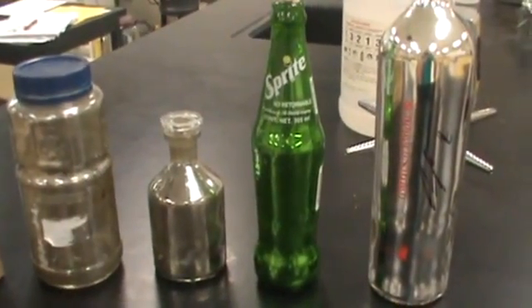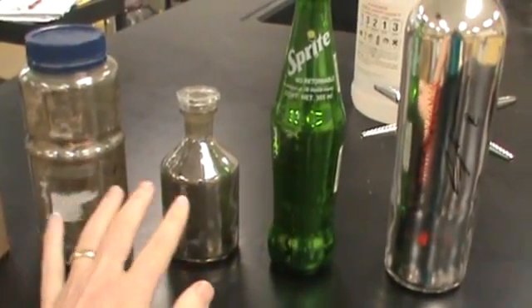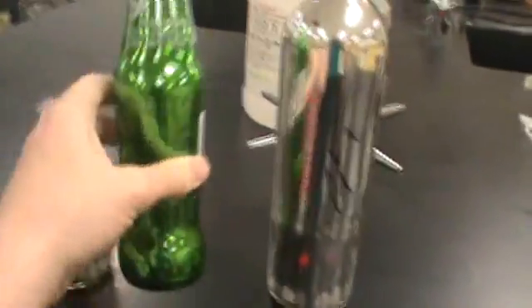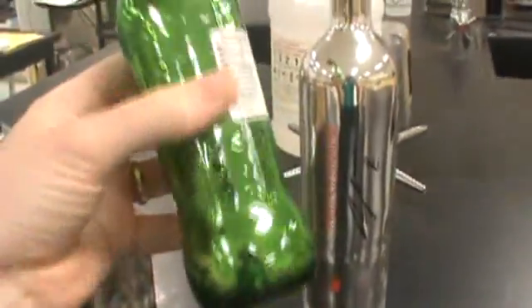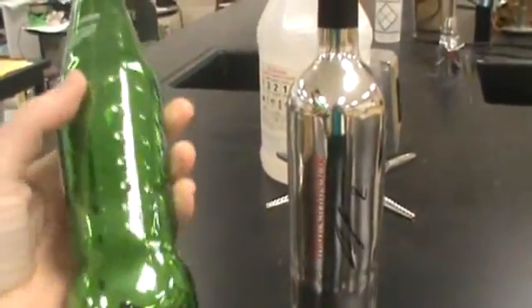So here we have the final product. This one was really not done very well, but this one's a little nicer. But here, when we get into the part where we shake it a little bit, this is where we really get a nice even coating of silver mirror on the inside. And it just looks great. And here is our Charles Woodson autograph. You can see in the reflection there. Okay, and it just looks really, really nice all the way around.